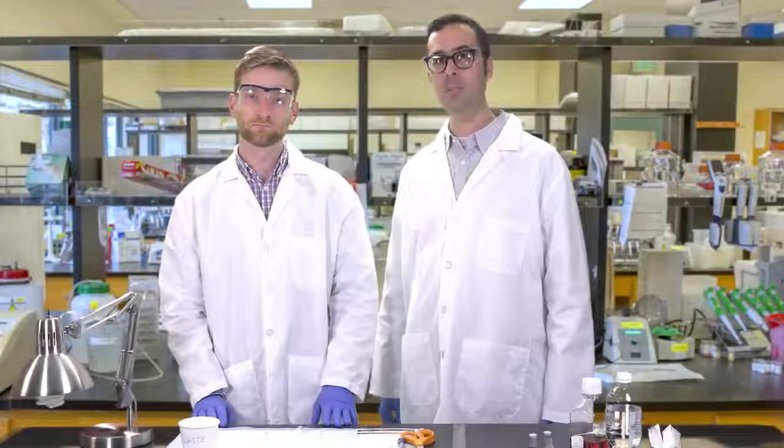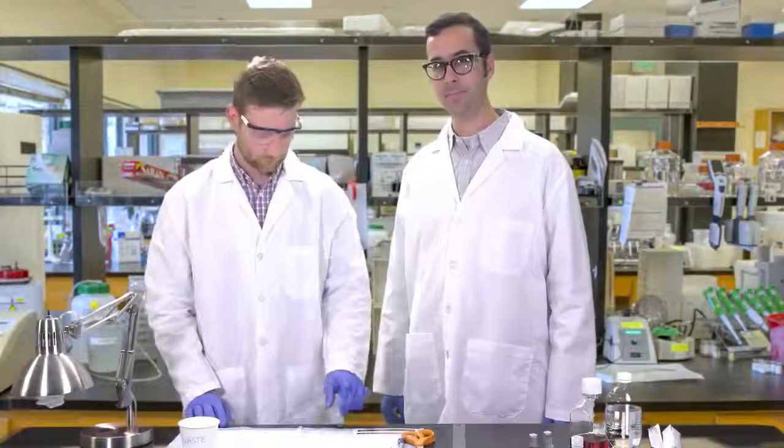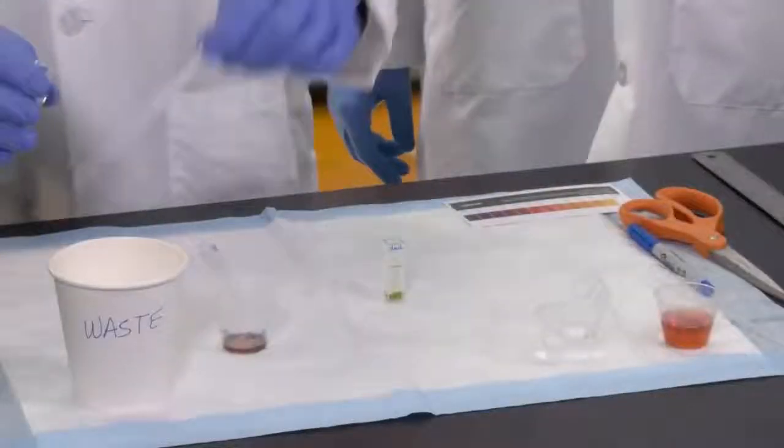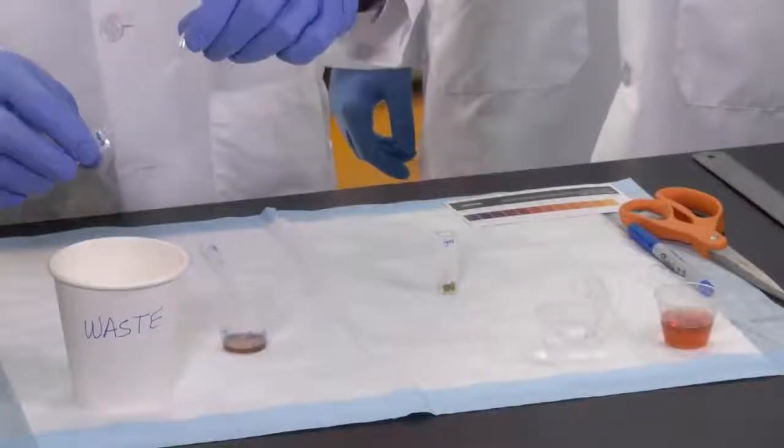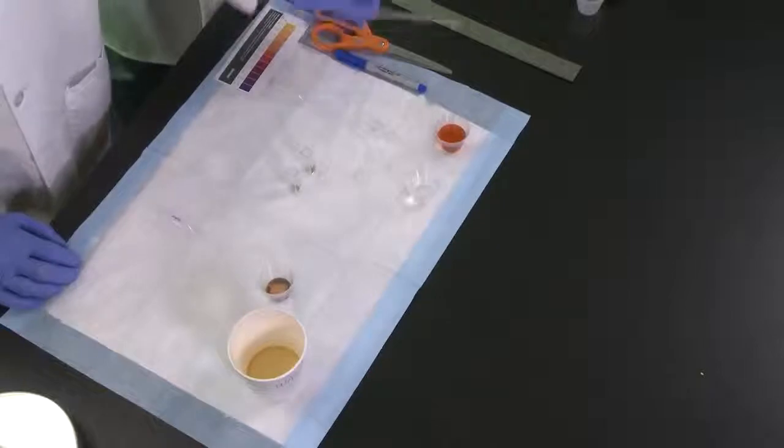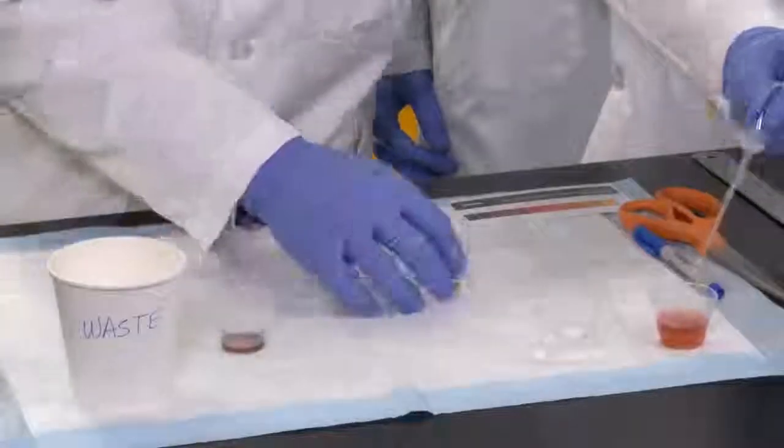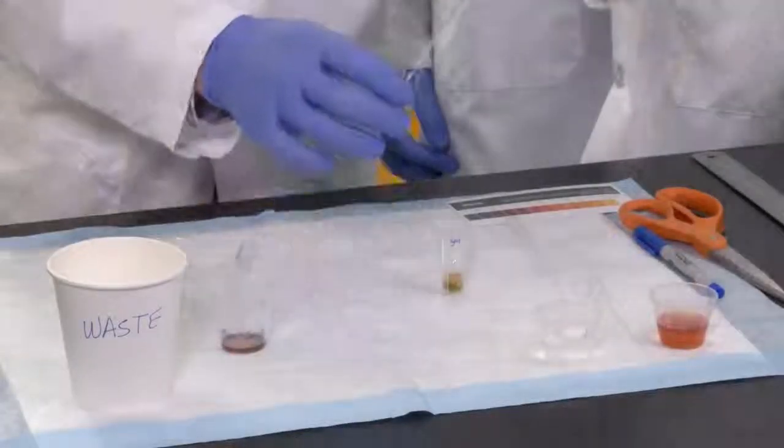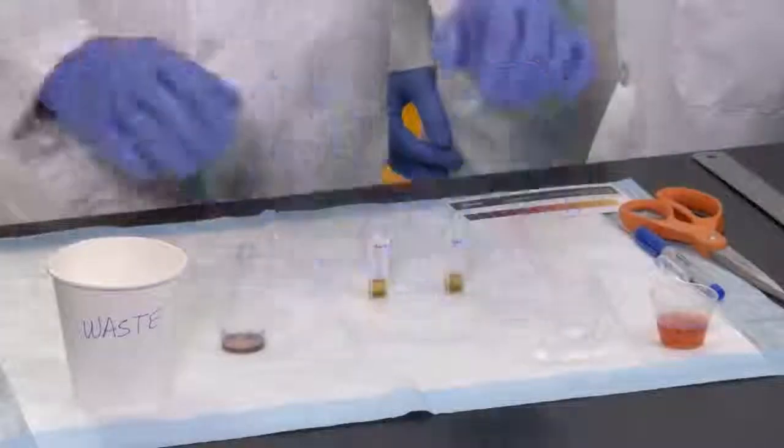After five minutes, remove the wash water. Then you can add fresh CO2 indicator solution and cap the cuvettes tightly. Now you are ready to set up your experiment.